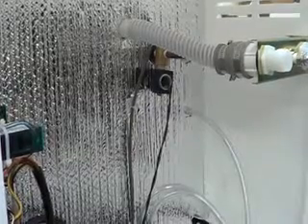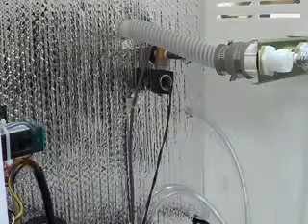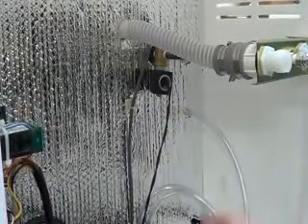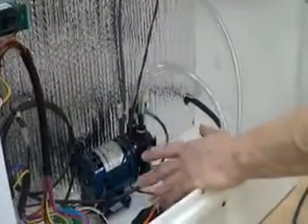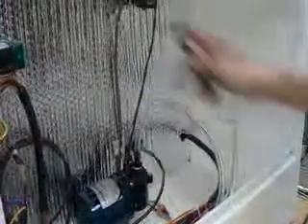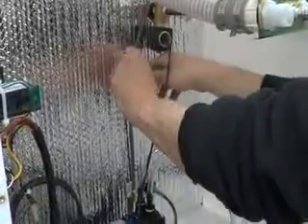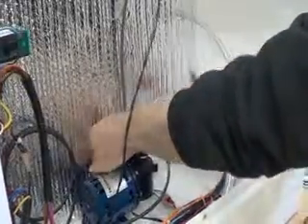Once you have the light unbolted, you need to come into the chamber cavity and free up the wire. This is a 5518 chamber — it's different from the 5532 chamber. The pumps are different, the internal humidifier is not there, but the light and the wiring is the same, so this still applies. We're just going to cut free the cable ties on this wire.